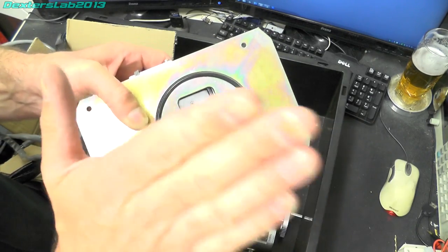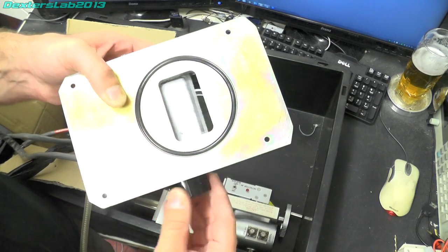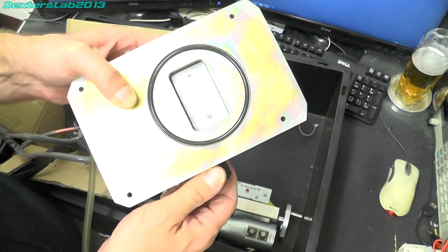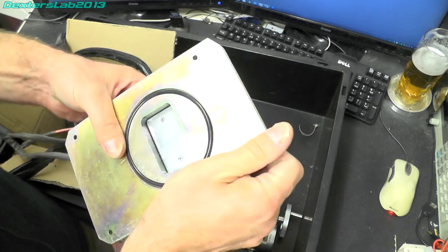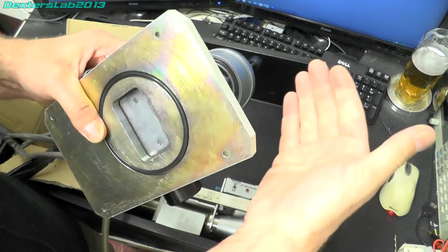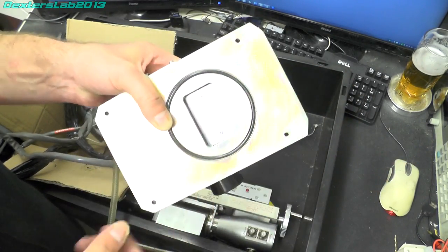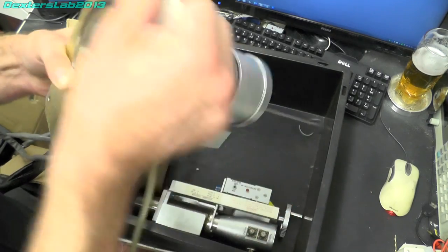Obviously this side would have been under the vacuum so as this door went up and you had atmospheric pressure on the outside then that would seal shut very very tightly.